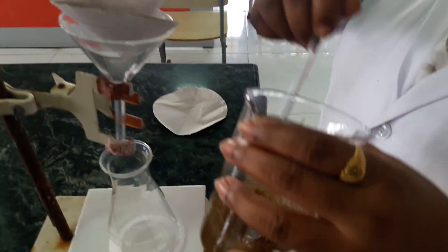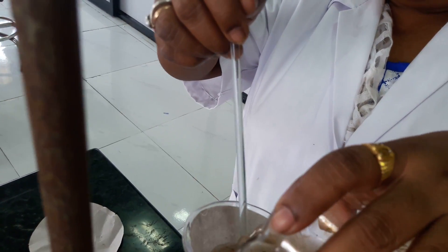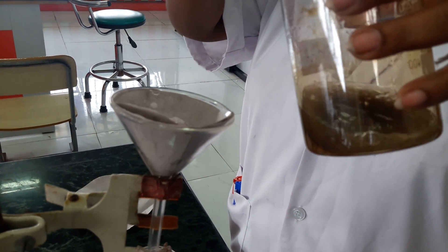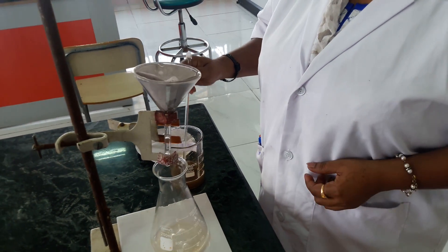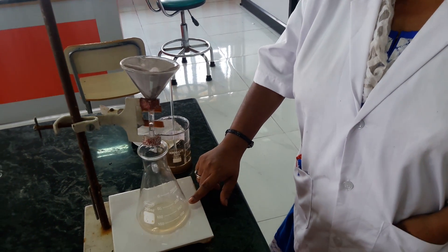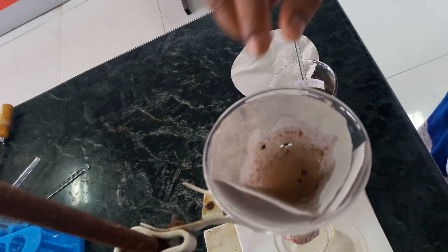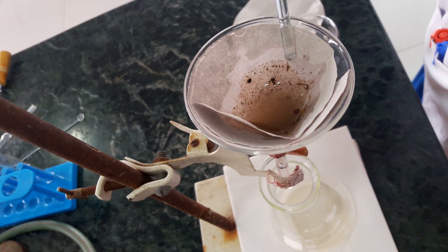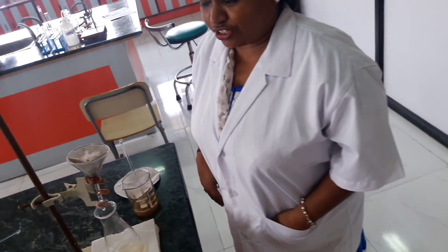Now when I pour this soil in water, you can see the particles over here. This liquid that passes through is called the filtrate. The sand particle left on the filter paper is called the residue. So this is how you carry out the filtration process.